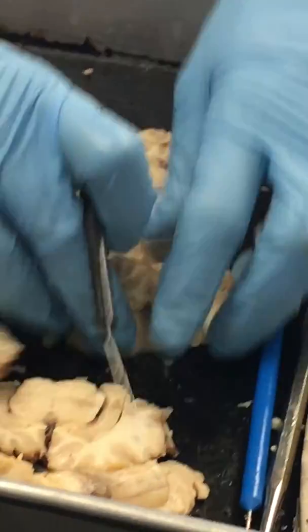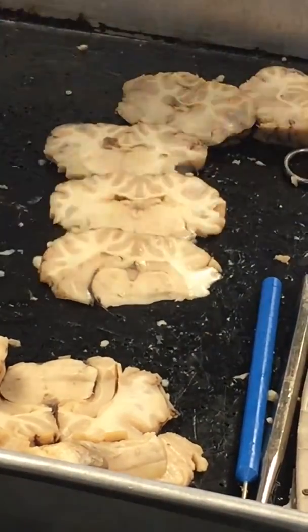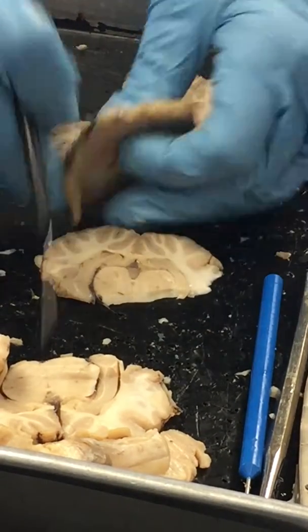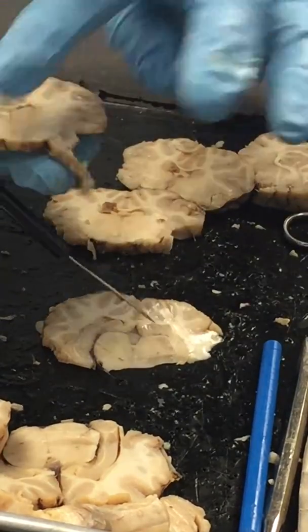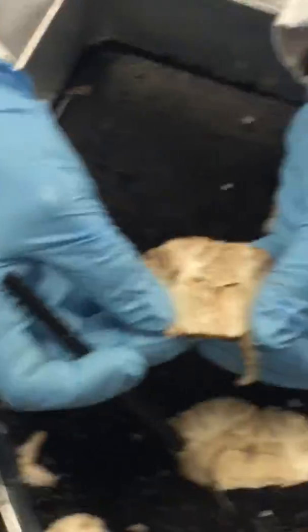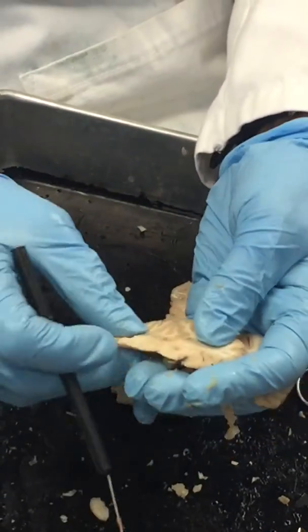As you keep looking at this, this is our thalamus here, those two big globby things that kind of sit on both sides of the cerebrum. Or like the cerebrum kind of encompasses. That was what we have here. You can see those thalami there. The third ventricle runs between the thalami, okay? So that's why you end up seeing this space here between them is that third ventricle.